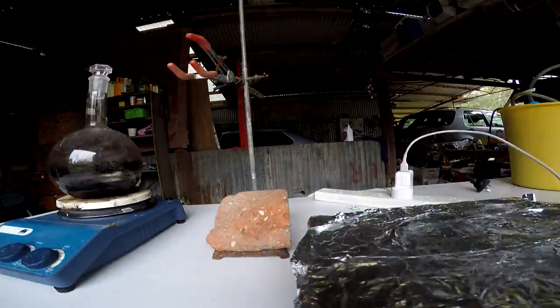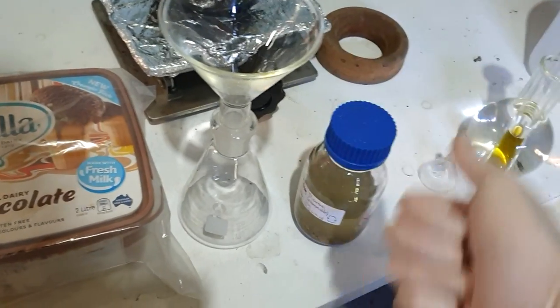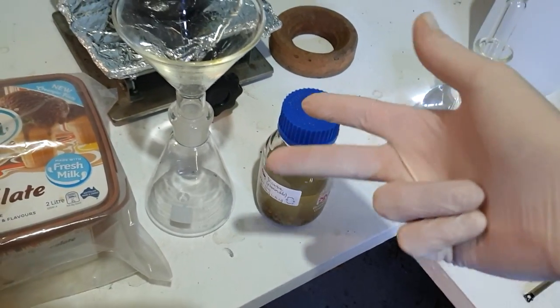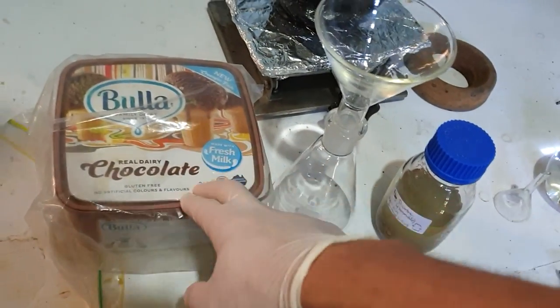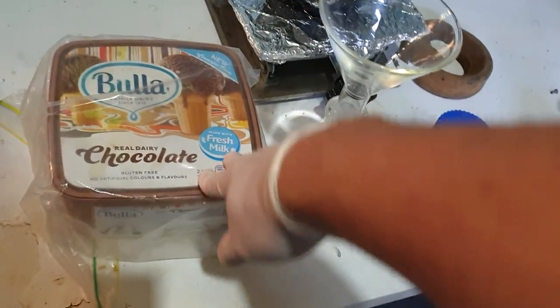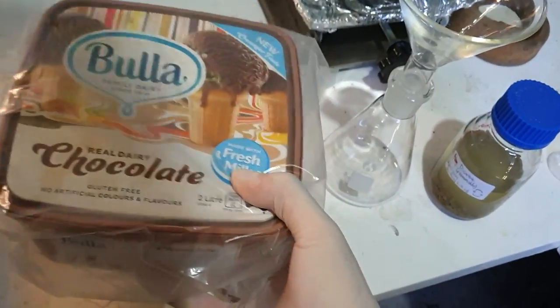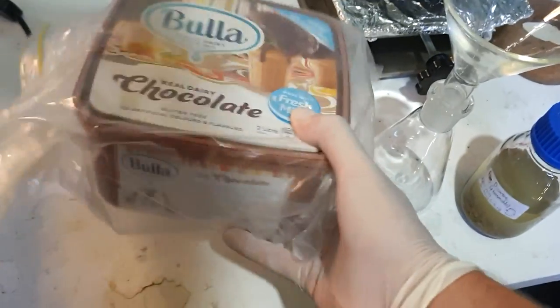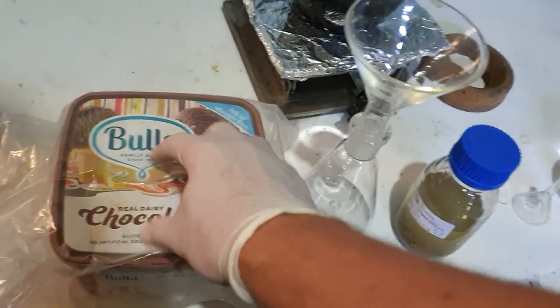All right, so here's our dioxane. I've combined it with the old dioxane. It's very yellow of course, so I'm going to do something about the peroxides, vaguely dry it out, and also remove some of the yellow. What we're going to be doing, as we did in the previous dioxane run, is put it over some chocolate ice cream, which in our case is potassium hydroxide. I don't know how it's managed to survive in this chocolate ice cream container for so long.